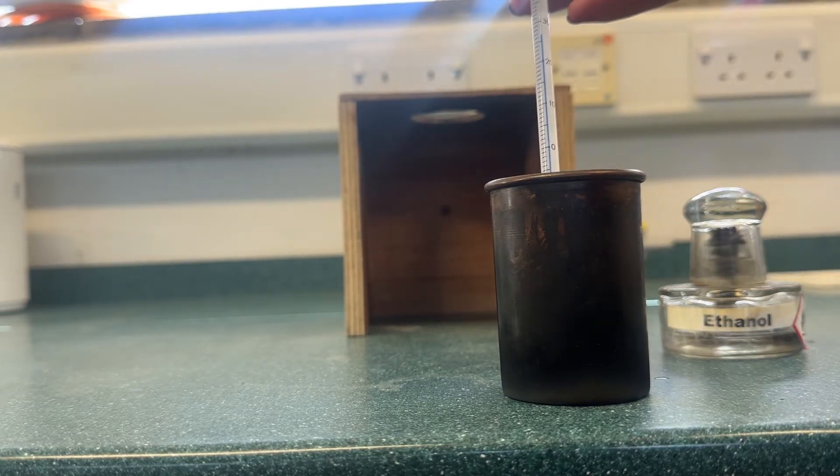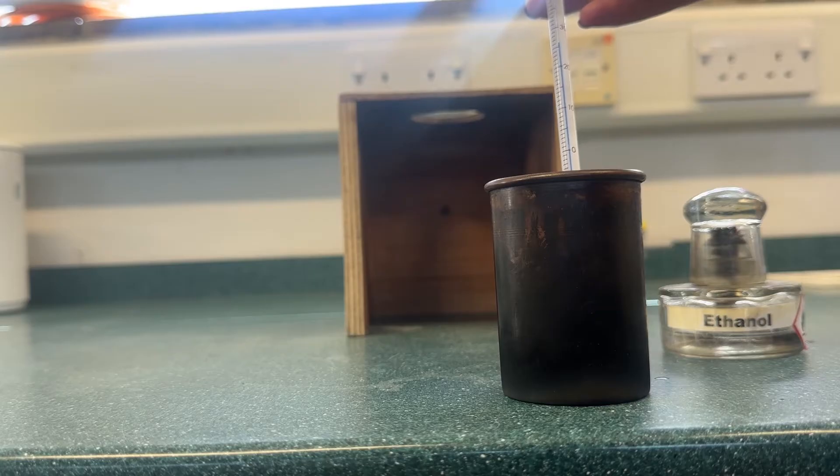You then need to take the temperature of the water at the start. This will allow you to calculate the difference in temperature, delta T.